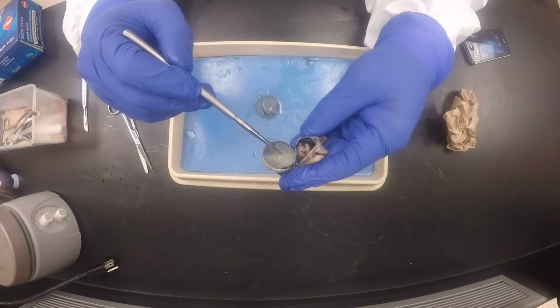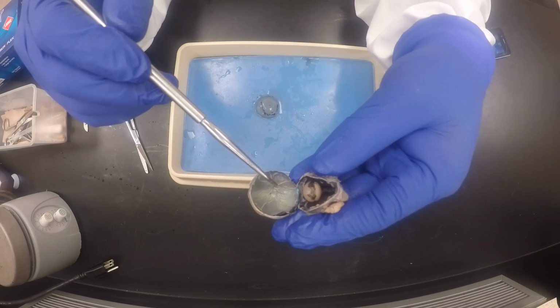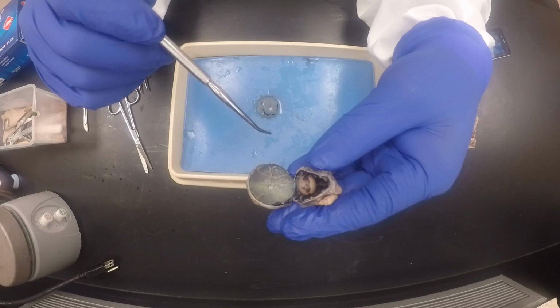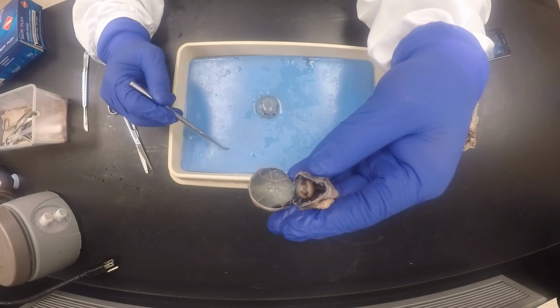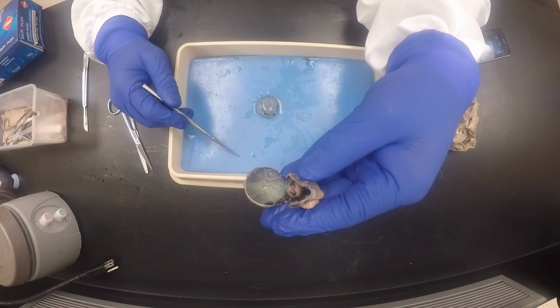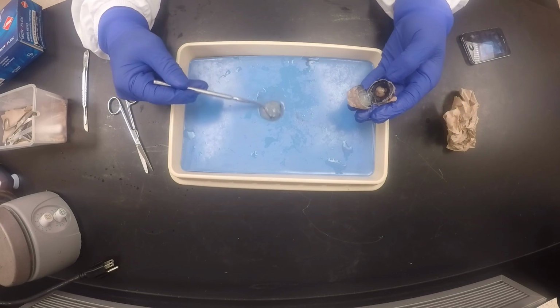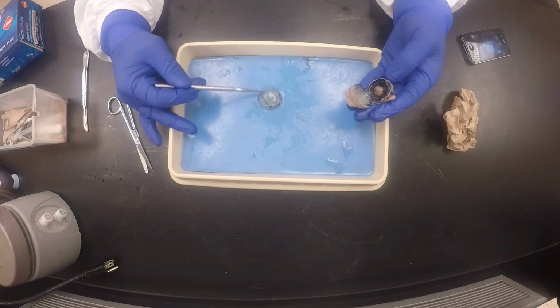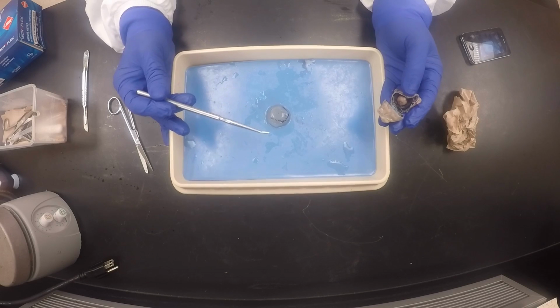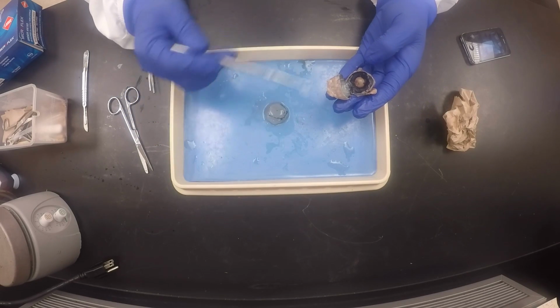And then in that little dot right here, this is the optic disc, or we call it the blind spot of the eye, because there are no photoreceptors there. Those are all the parts of the eye. The vitreous humor, we removed it, but you can see it still looks like a gel, right there. So, 7 extrinsic eye muscles.